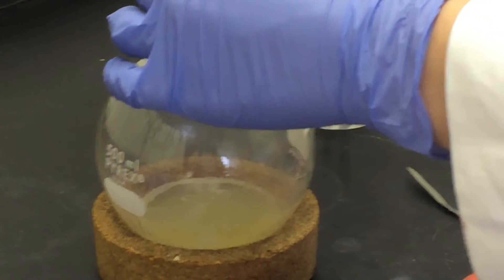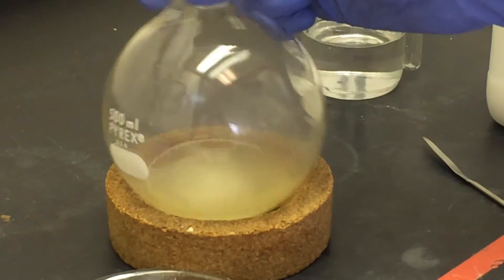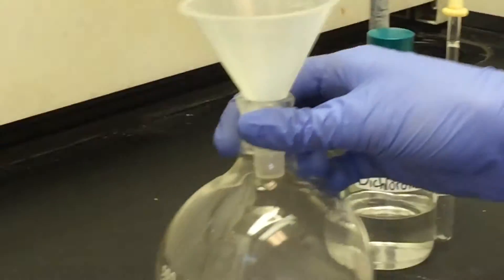This is a little bit more. So when your sample starts to look a little cloudy, you know that you're all set to go.